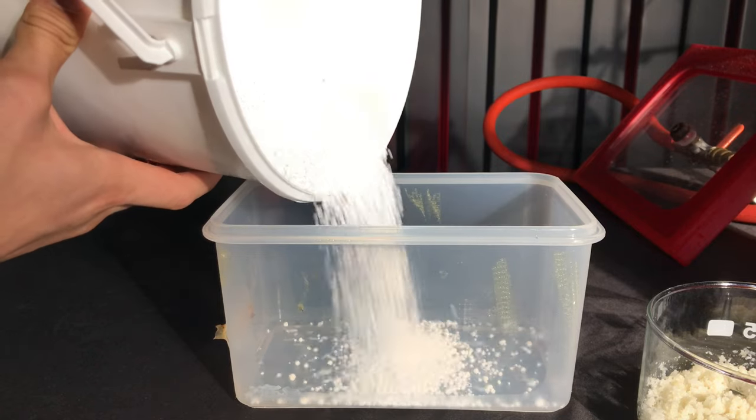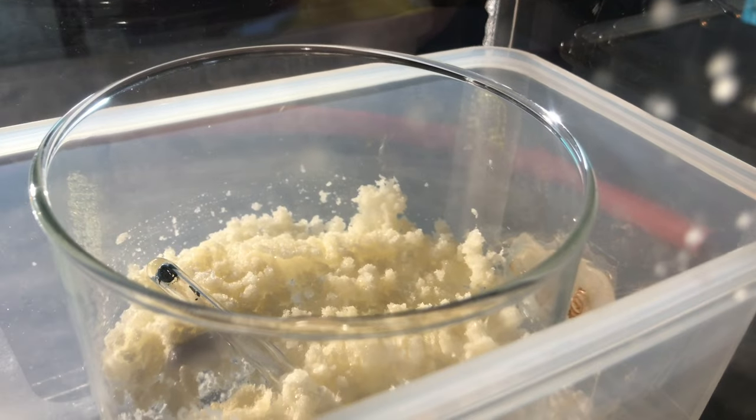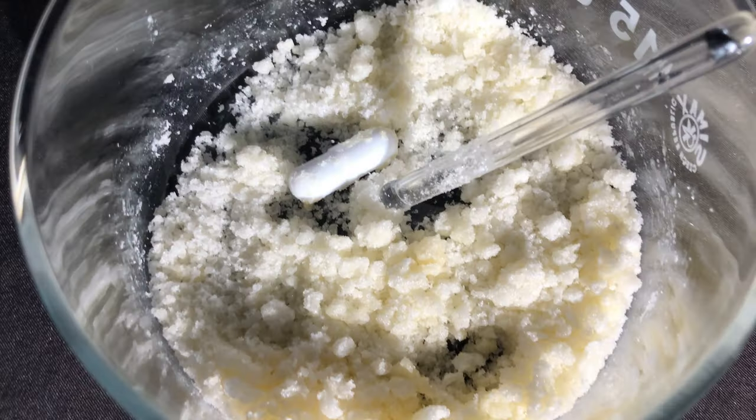To get rid of the last bit of water anhydrous calcium chloride was put into a plastic tray and I crammed the crystallizing dish into the top. Under vacuum the water evaporates even quicker and therefore I pull the vacuum.